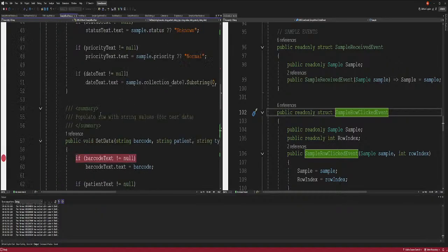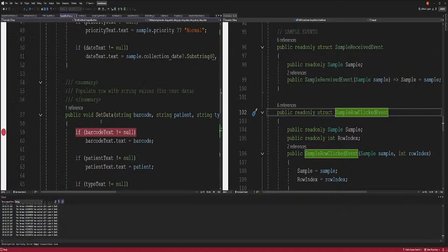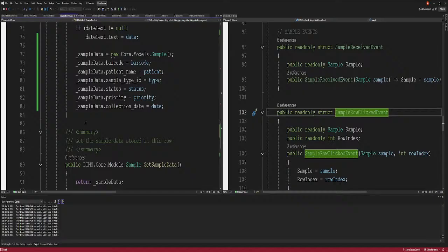And the reason why this one worked was because this was an object already, and you assigned it the whole thing in one shot. So you didn't need new. But on here, you need new. Okay, come on. It takes too long. All right, so while this is loading up, this is ridiculous, we'll talk about the rest of it.